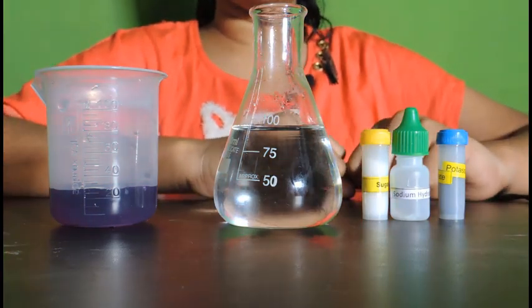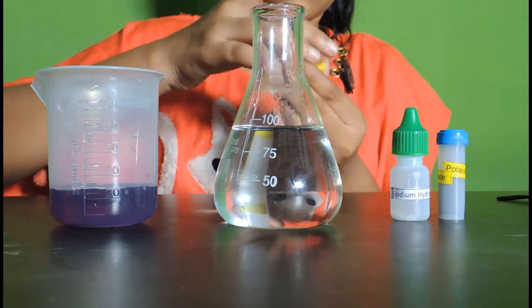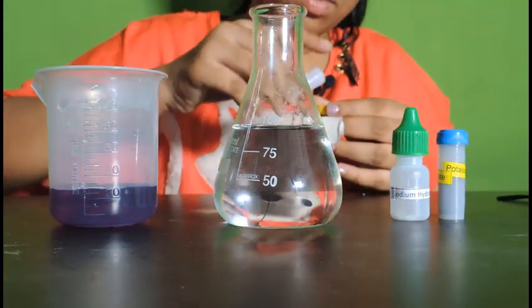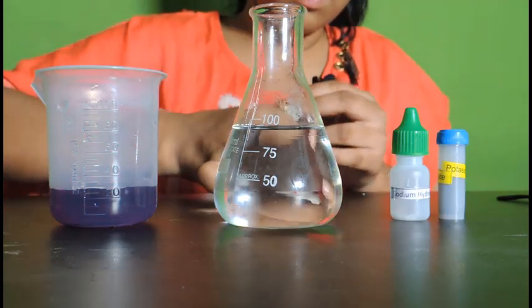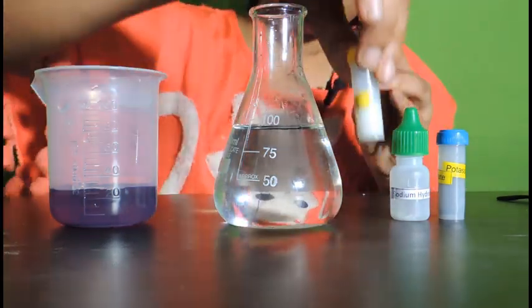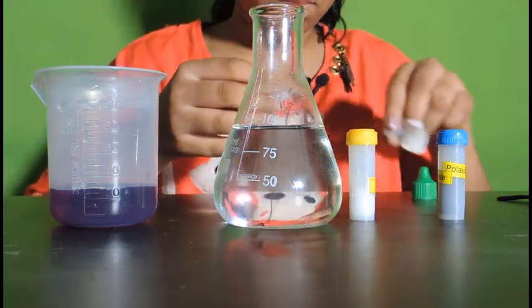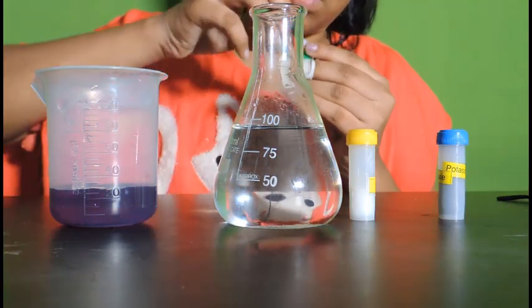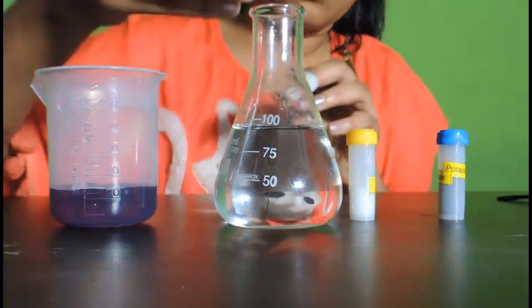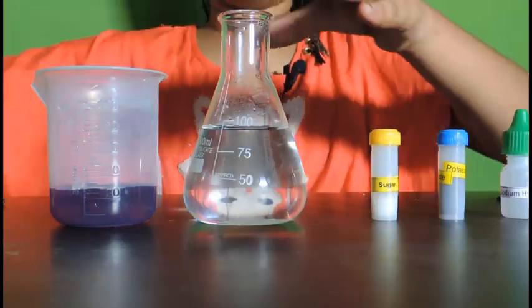Now let's prepare a solution of sugar and sodium hydroxide. Add 2-3 tbsp of sugar. Now let's add 2-3 scoops of sodium hydroxide. Now let's stir the solution well.